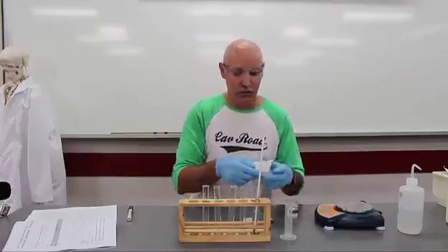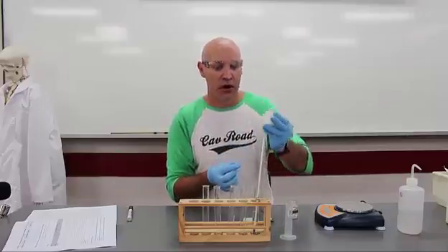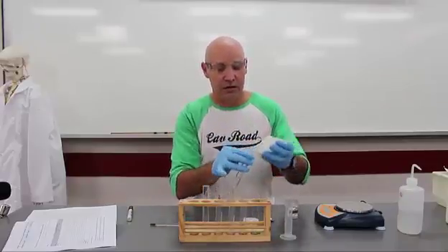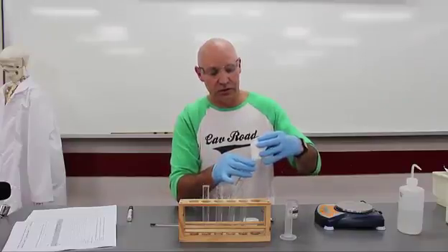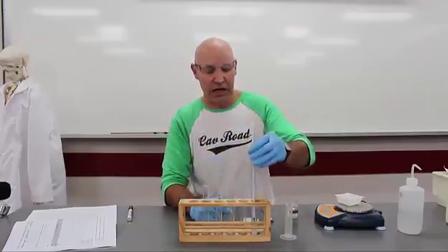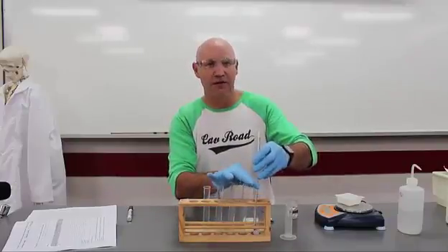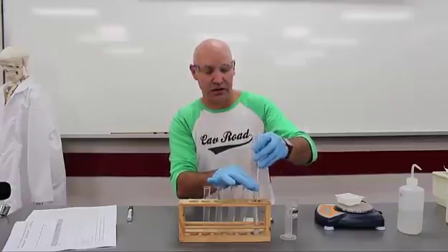Here's a trick with using your weighing boat, fold it like this to allow it to be like a funnel. Alright, so let's tip it in. Make sure you tip it all in. You need to be a little bit careful with this, make sure it's all in there. And then we're actually going to use a thermometer very, very gently as a stirrer. Remember you started your watch, and this is why you need other people to help you out in the group, after 30 seconds you're going to be checking the temperature again.